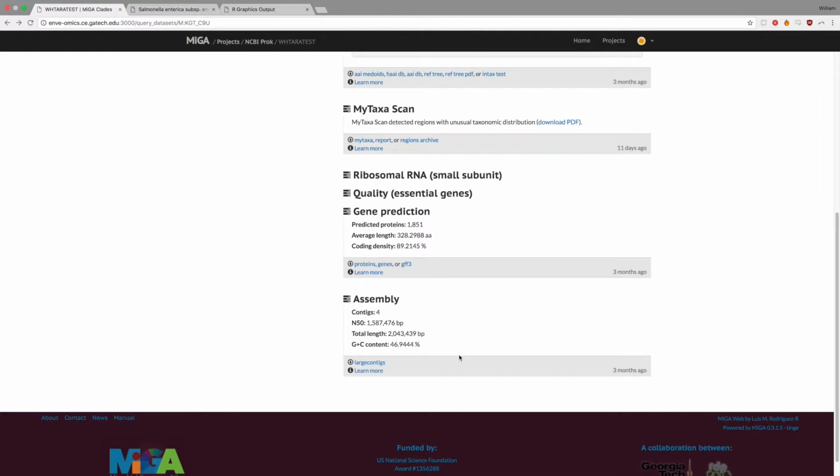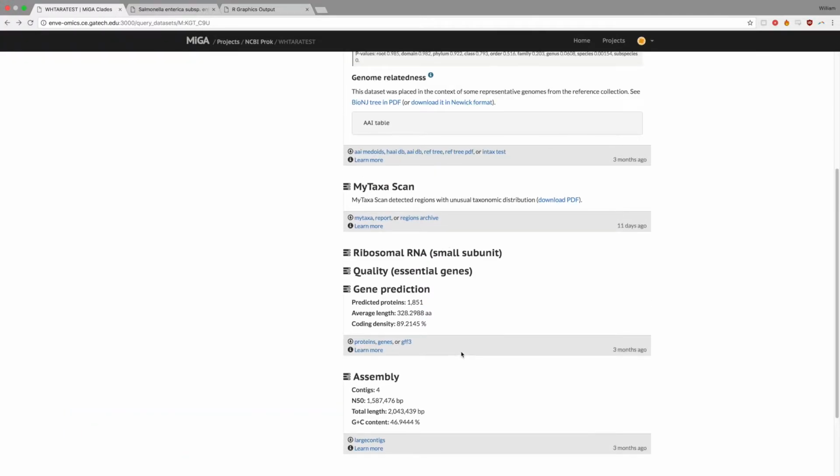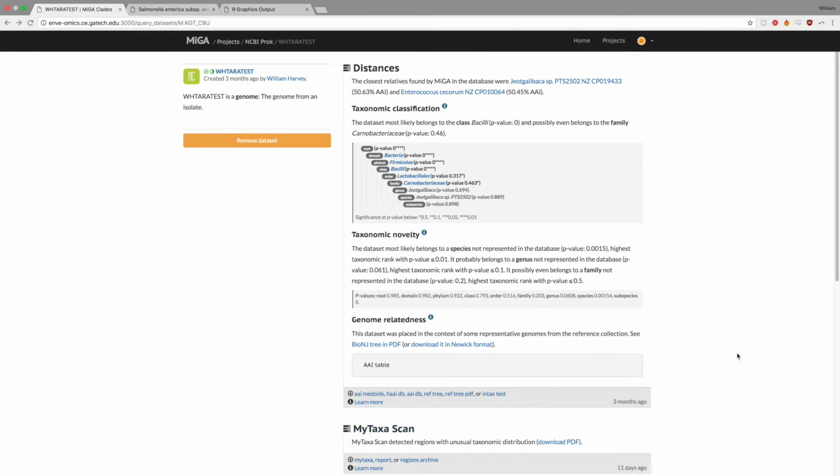By utilizing the available information generated by MiGA, users can thoroughly evaluate the quality of their assembled genomic sequences and even make further inferences about the success of different assembly or binning pipelines, for instance. In the end, areas of chimerism should always be manually examined by the end user and might not always indicate diminished genome quality, but cases of recent horizontal gene transfer or other naturally occurring genetic deviation.